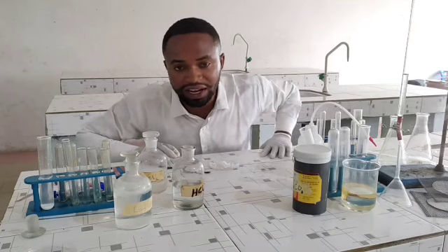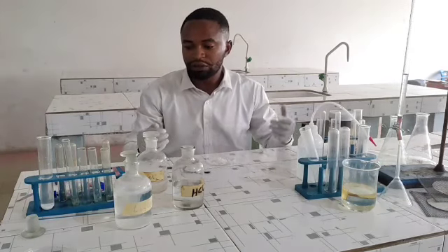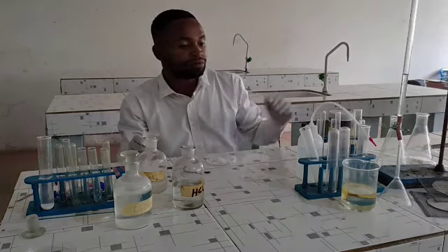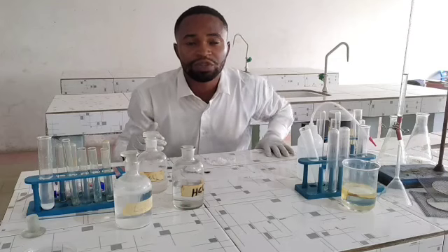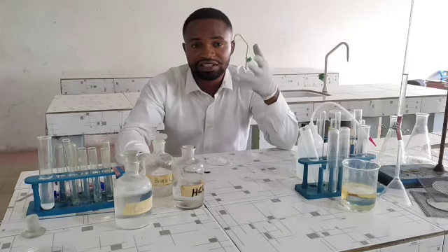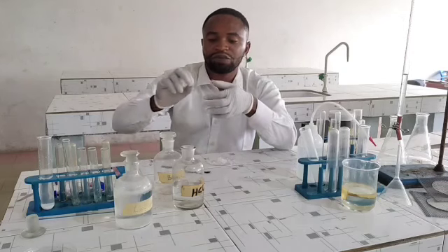Now, it's time for me to carry out my analysis. You may be asked to test sample C with a litmus paper. Remember, the question will just say litmus paper. They won't tell you red litmus paper or blue litmus paper. So you have to carry out the test on the red litmus paper and on the blue litmus paper as well. From your knowledge in chemistry, any sample that gives a positive test with a red litmus paper will definitely not give a positive test with a blue litmus paper. So at this point, I have my red litmus paper here.